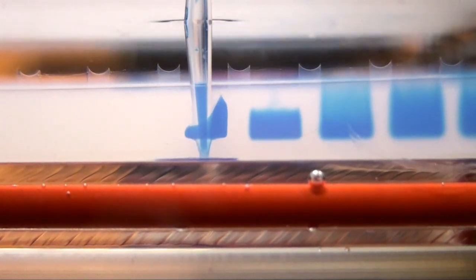Here is the classic shoving your tip through the bottom of the gel. Just be aware of where your tip is. As you can see down at the bottom, the sample is lost underneath it and you have inadequate loading of your sample into the well. Sometimes you have enough in your well to do the electrophoresis, but other times you've lost some of your sample.